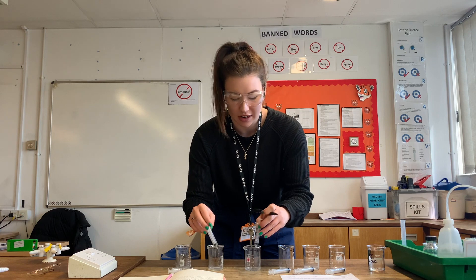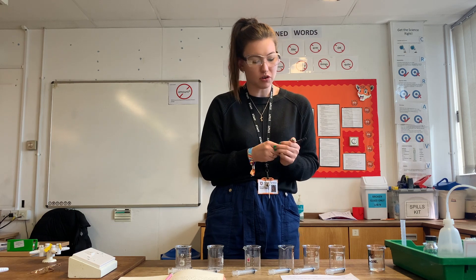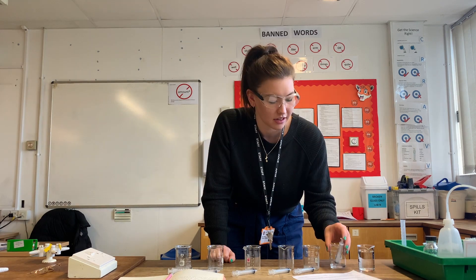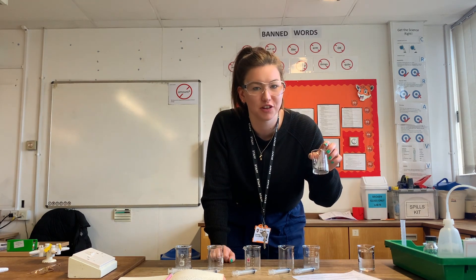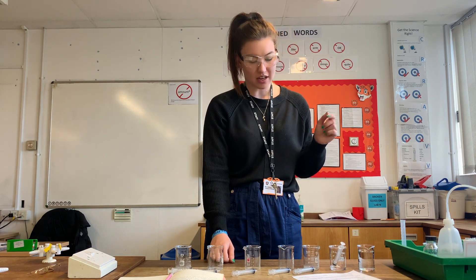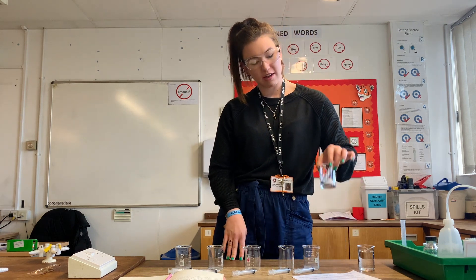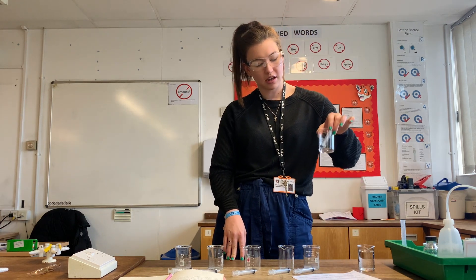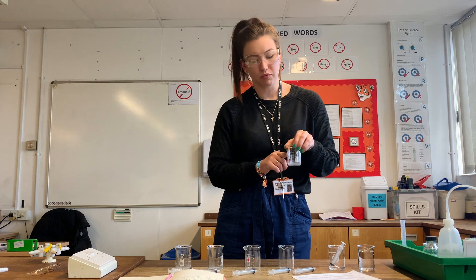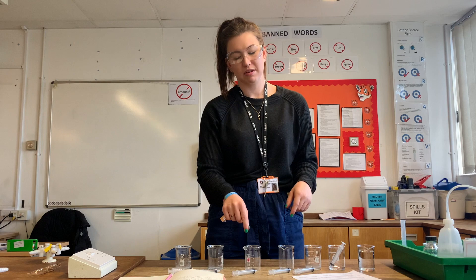You'll also notice I've got a different syringe in each beaker, so I can be sure I'm not transferring one glucose concentration from one beaker into another. I've got my 10 centimeters cubed of one percent glucose, and then I'll take five milliliters of the one percent glucose solution and pop it into my next beaker, then add five centimeters cubed of water - taking half and mixing with half water - and I'll do the same again, same again, same again.